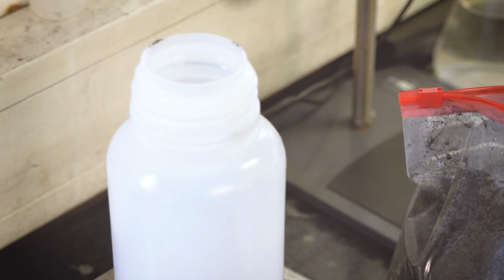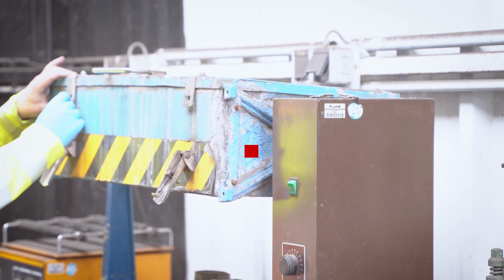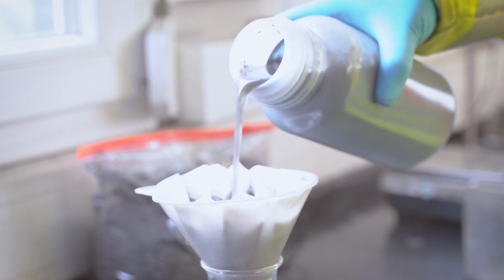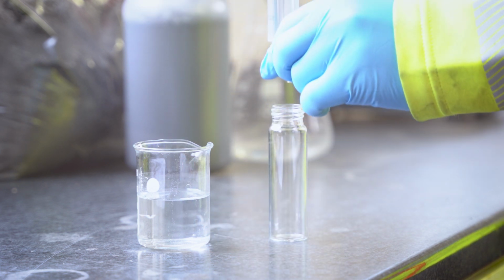Further parameters, like heavy metals and DOC, require the preparation of aqueous eluates by an overhead shaker. After removing the particles by filtration steps, the DOC and heavy metal parameters can be directly determined.